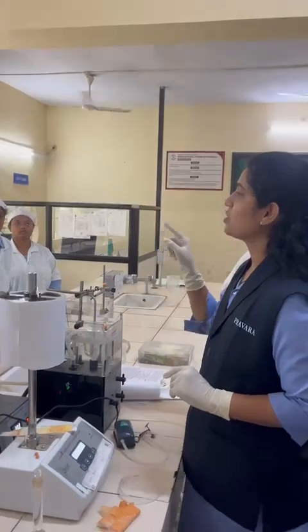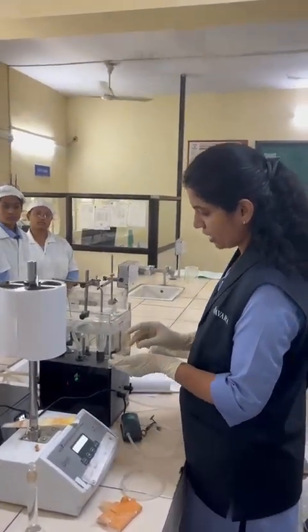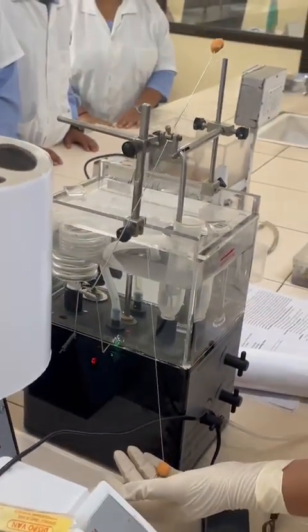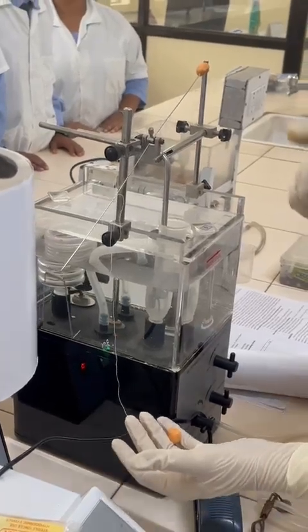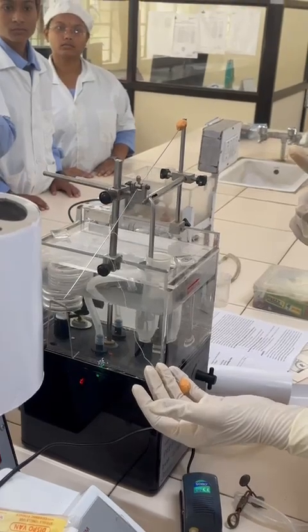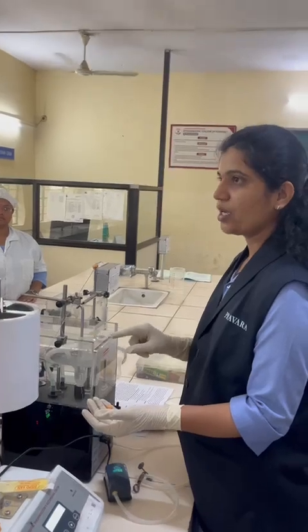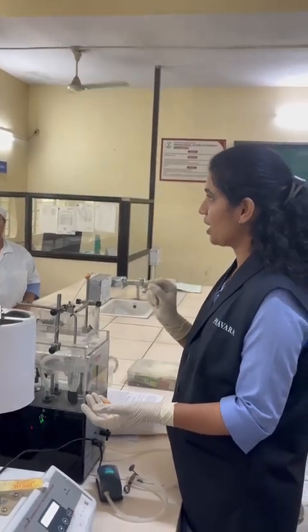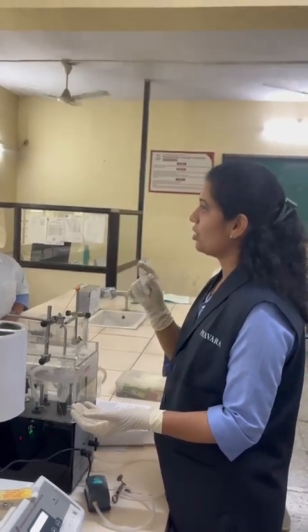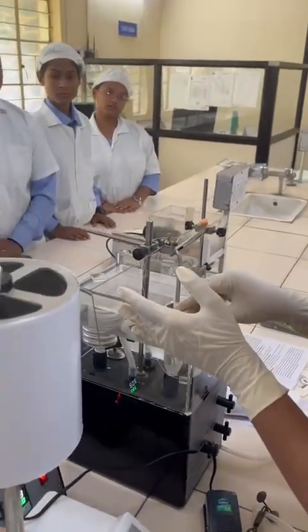To balance the workload of this lever, we have to attach one more load at the front side. Whenever there is washing, at that time you have to pull this load to the downside, so there will be no disturbance in the graph. This is one benefit. The second benefit is there will be some minor stretching of your tissue also. 30 minutes is the stretching time for your tissue, so there will be stabilization of the tissue, and you can easily get the response of that particular drug.